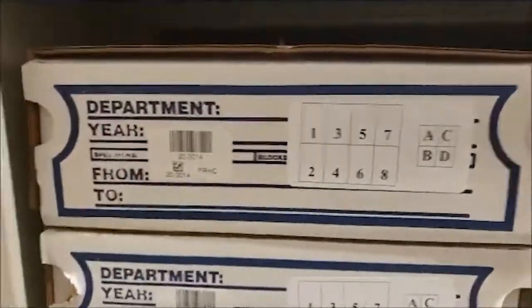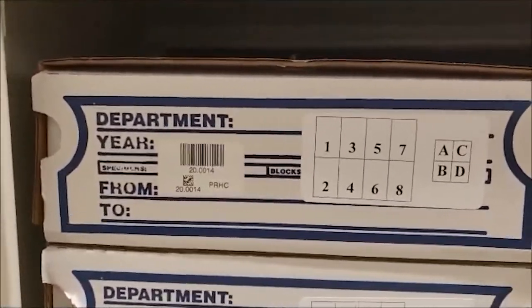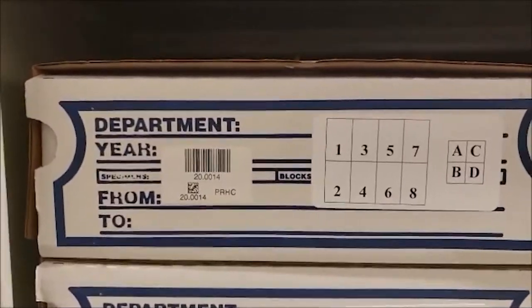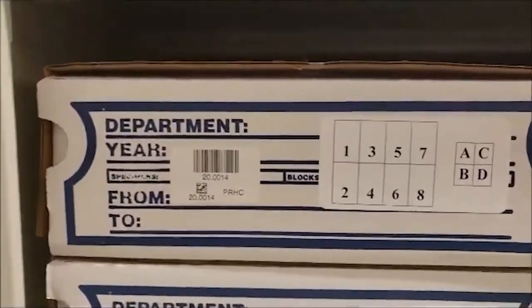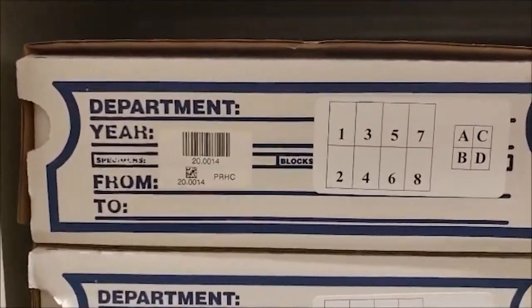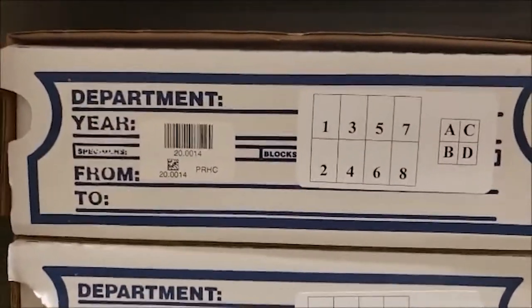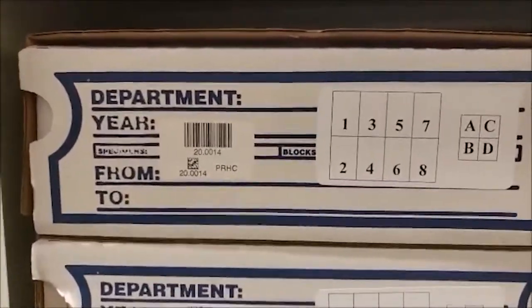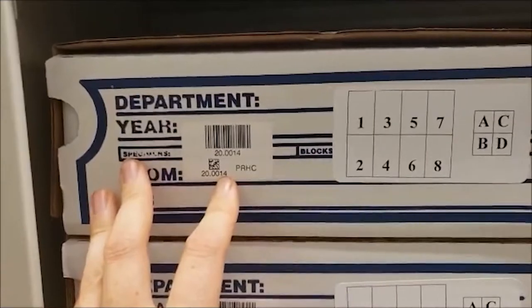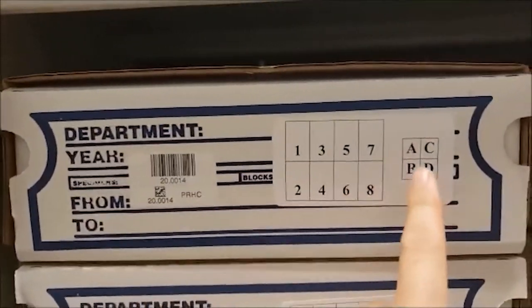Rather than finding your slide in ascending order like you would traditionally do, you would look it up in the system, go through the proper retrieval process under your login, and the SlideTrack software is going to tell you where to retrieve your slides. In this case, we'll use the example of box number year 20, box 14, and we're going to say it's in magazine six, section B.